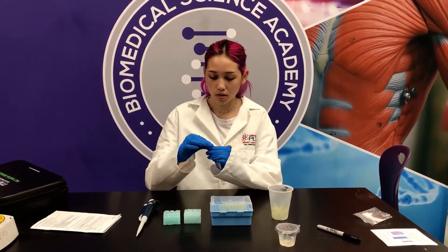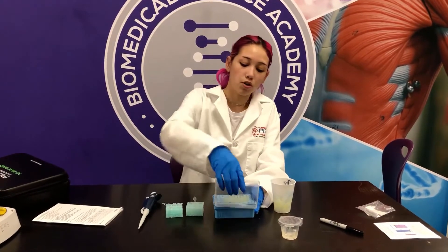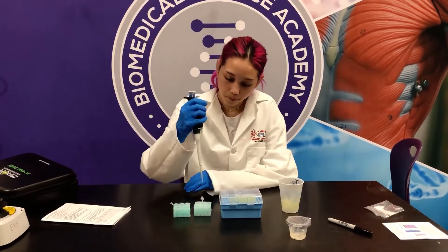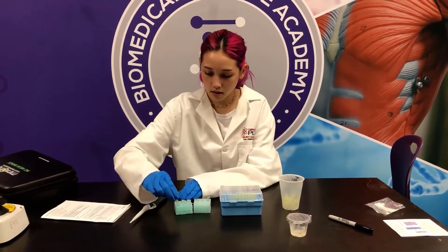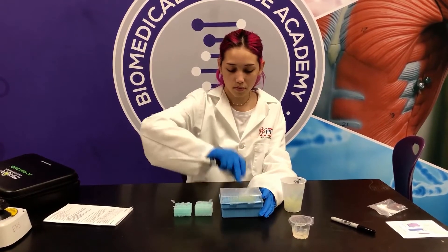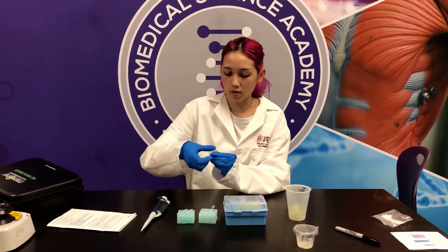I'm going to keep the micropipette at five microliters, and then I'm going to open up tube three and six. Now I'm going to put a new tip onto my micropipette, close it, get the restriction enzyme and put it into tube three. Get rid of the tip and close tube three. Get another tip for the micropipette, get the enzyme and put it into tube six. Get rid of the tip and close the last two tubes.